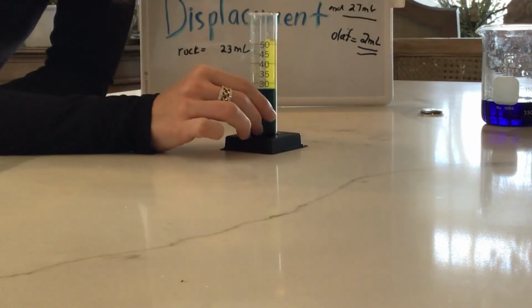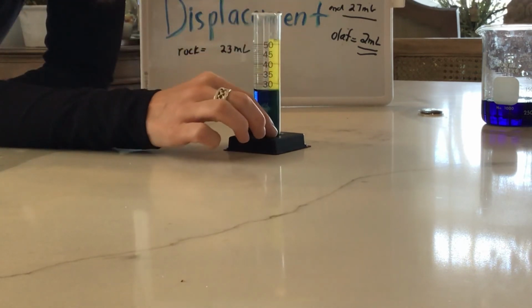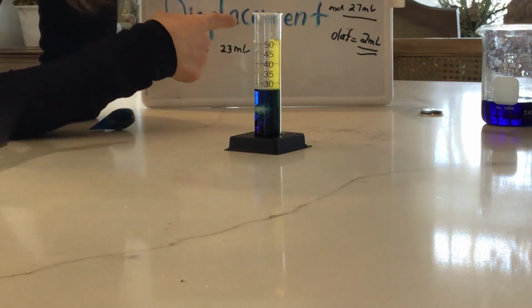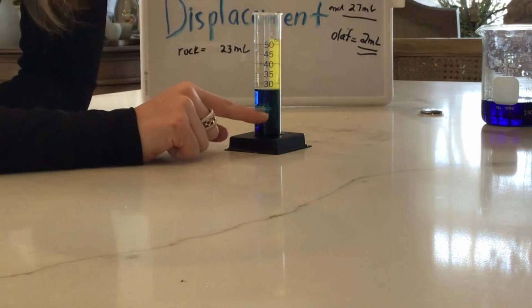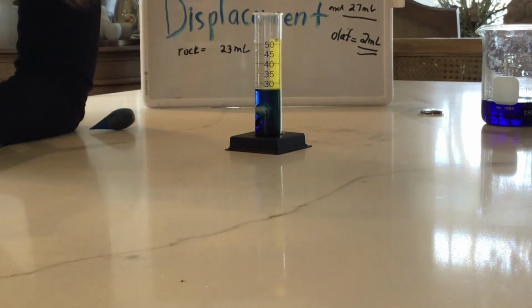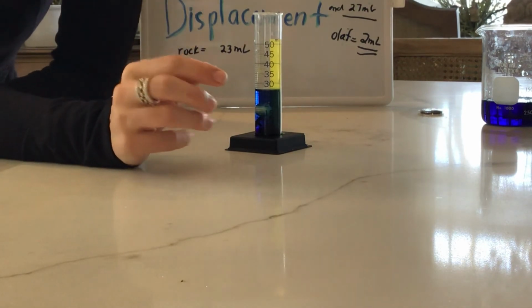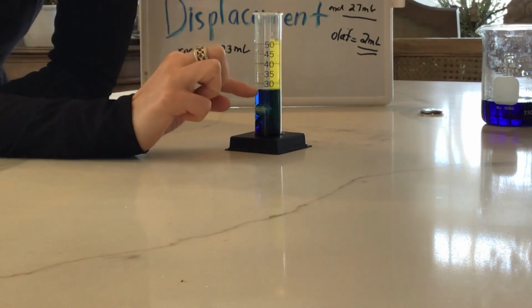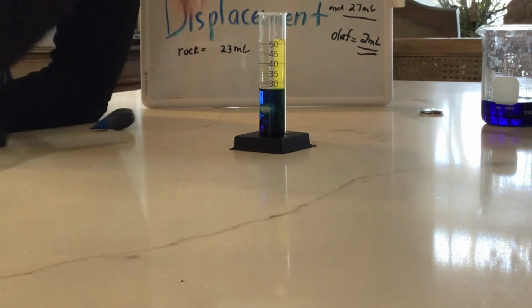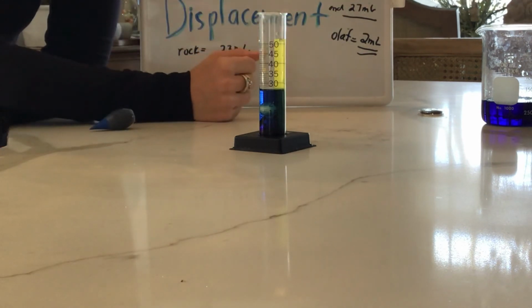So, you guys are going to be doing a worksheet where you see a graduated cylinder, and it has a starting measurement, just like the one that I showed you, that you have to measure, like I did. Then it shows you that there's an object inside of it. You're going to look at the object and then measure how high the meniscus is after it's been dropped in. And then you have to do a little subtraction problem.